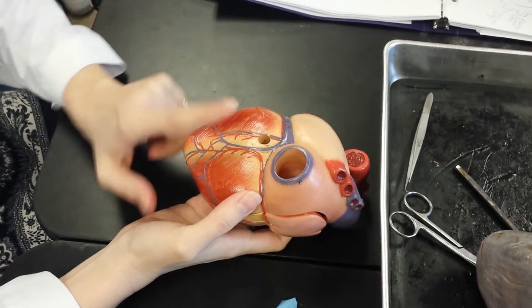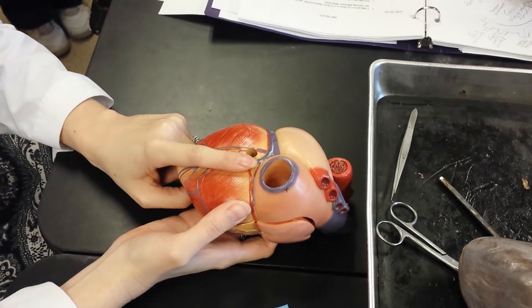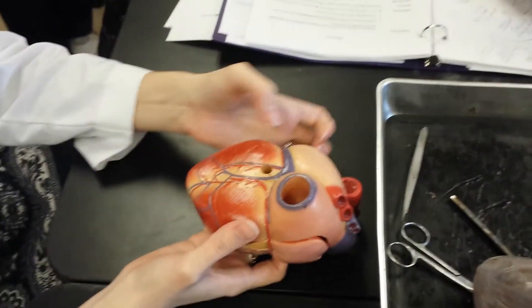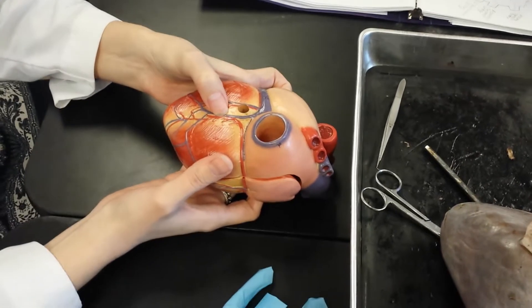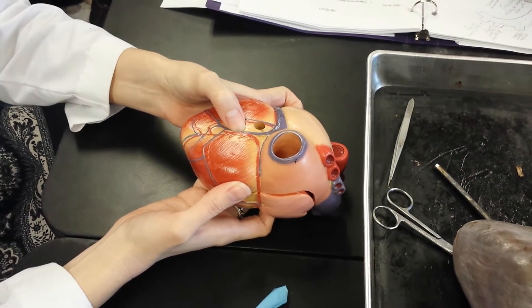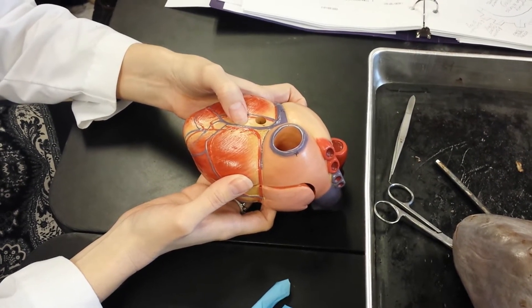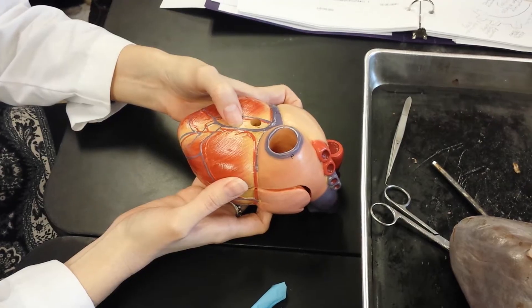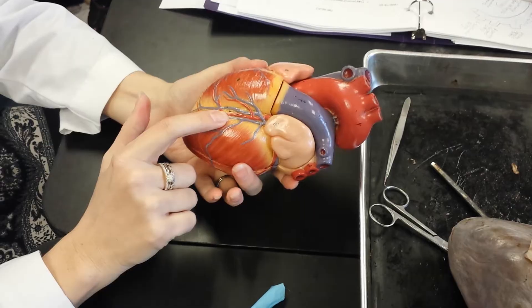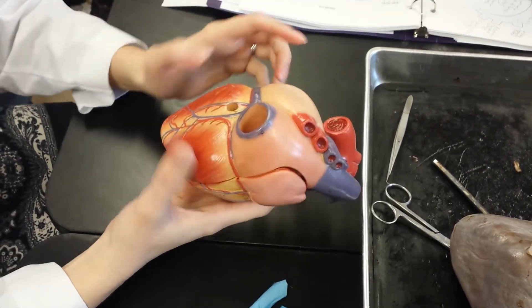I'll flip it over. On the back here, this groove is the posterior interventricular sulcus. Again, the red is the artery — so this is the posterior interventricular artery. The blue is the vein, and that is the middle cardiac vein. So it's great cardiac vein and middle cardiac vein, anterior interventricular sulcus and posterior interventricular sulcus.